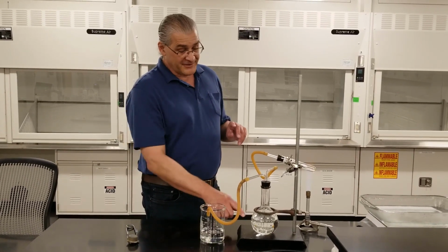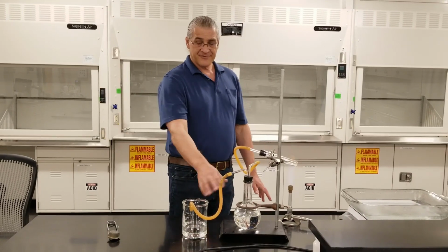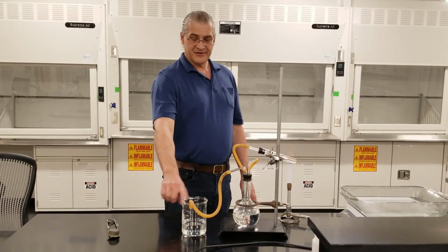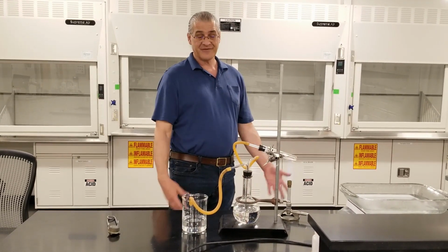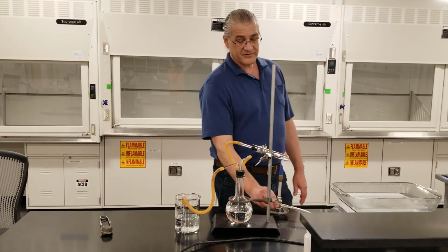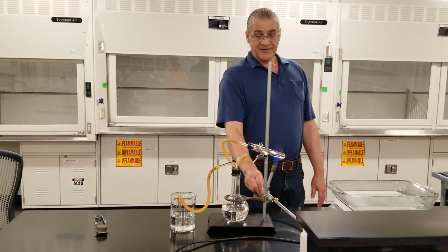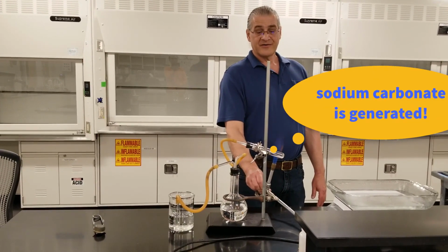Now, we'll probably drain this flask. How do we know when the reaction's done? Well, after it's drained, we'll see little bubbles of CO2 coming out. No more bubbles coming out, that means the reaction is done. So we're just cooking up our sodium bicarbonate, and we're going to be left with sodium carbonate.